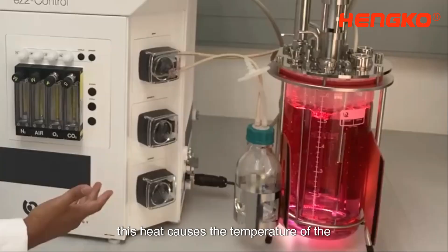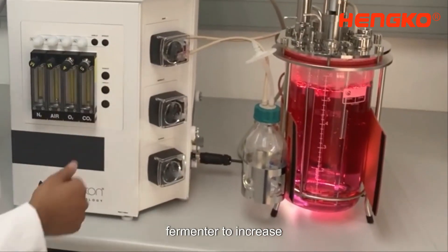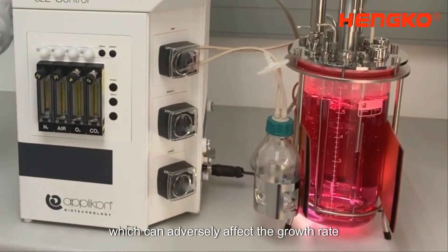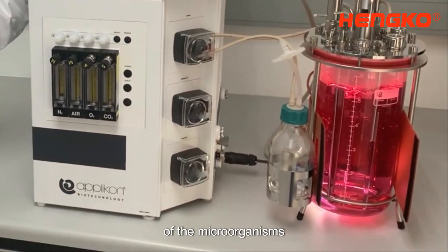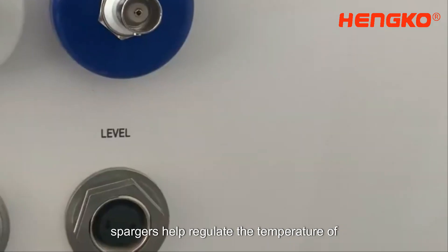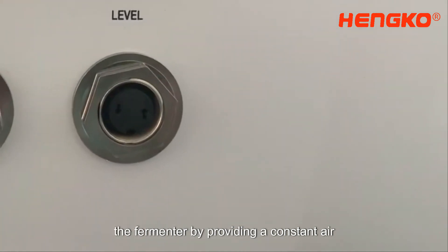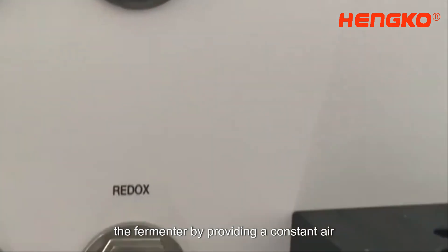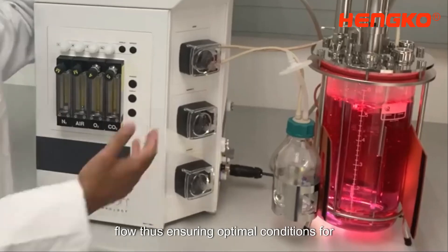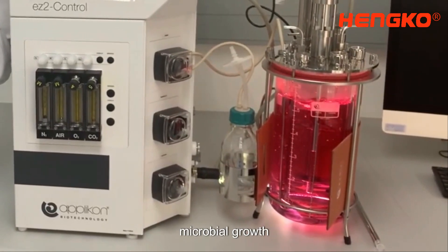This heat causes the temperature of the fermenter to increase, which can adversely affect the growth rate of the microorganisms. Spargers help regulate the temperature of the fermenter by providing a constant airflow, thus ensuring optimal conditions for microbial growth.